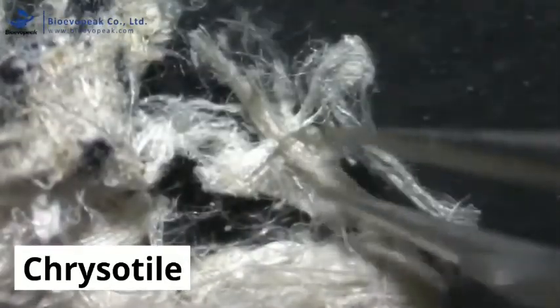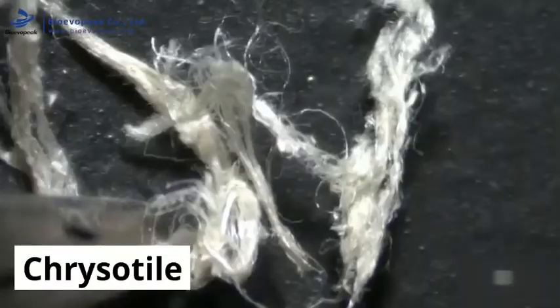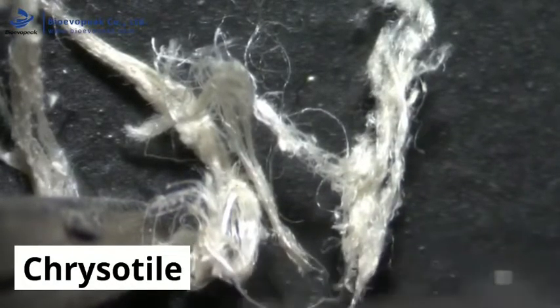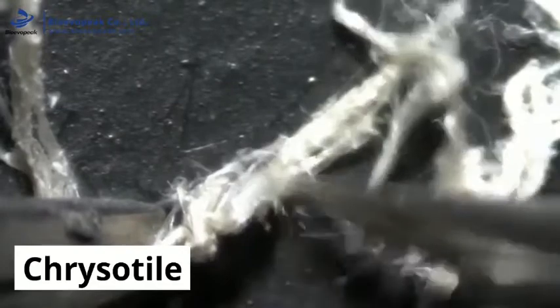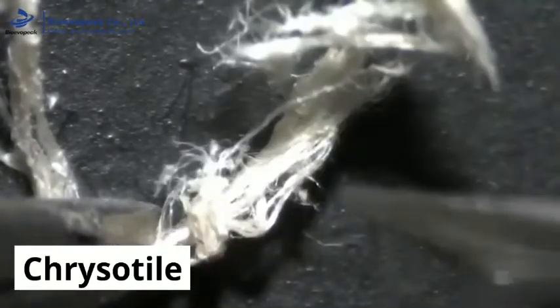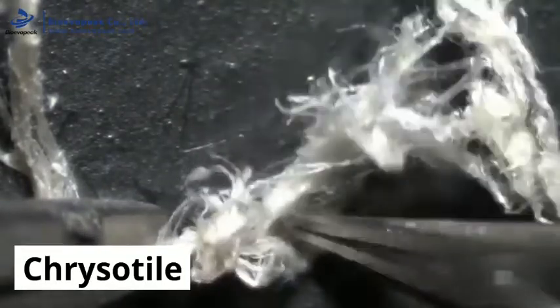These are then assessed for the splitting nature of asbestos and their level of flexibility. Chrysotile also has a very silky surface appearance, which is referred to as its lustre.